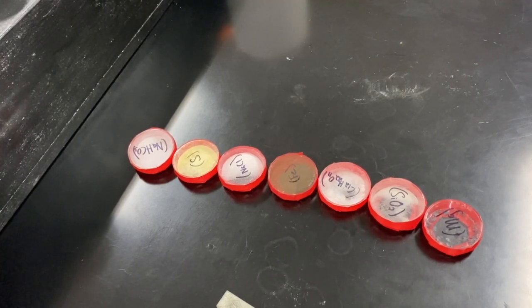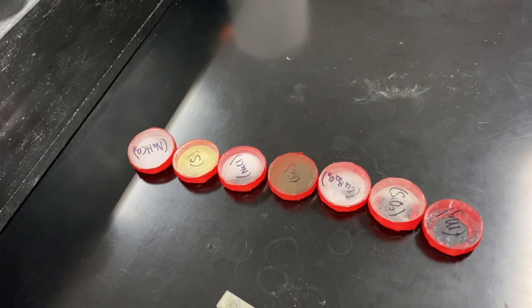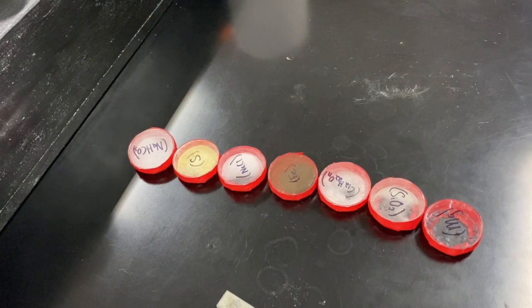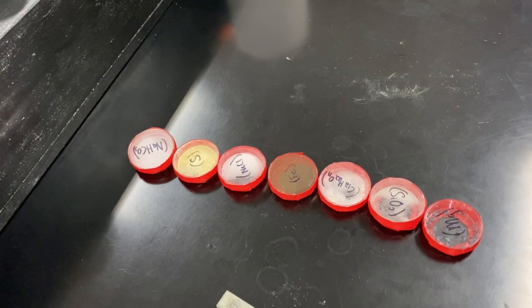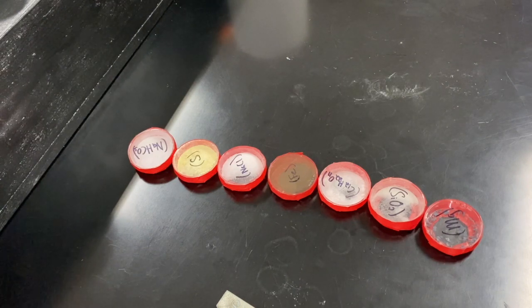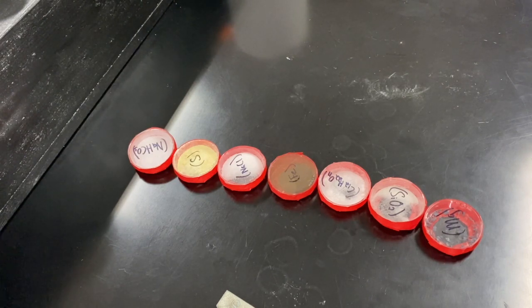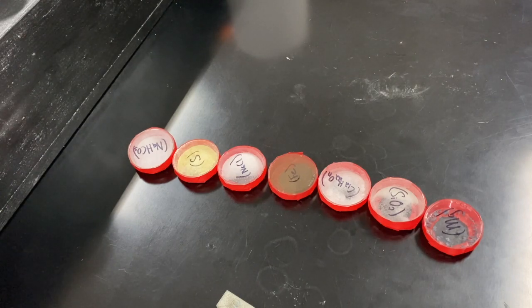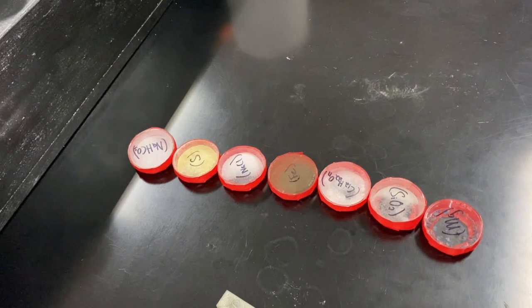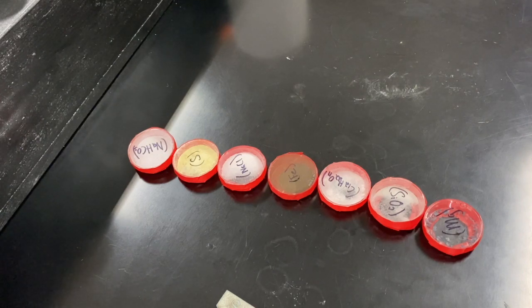Hello everybody. We are going to be doing the physical and chemical changes lab. This is a full two-day lab, so this particular lab video will be a little bit lengthier than normal. We're going to start with Part A, looking at the physical properties of matter. The first step is to examine some substances.